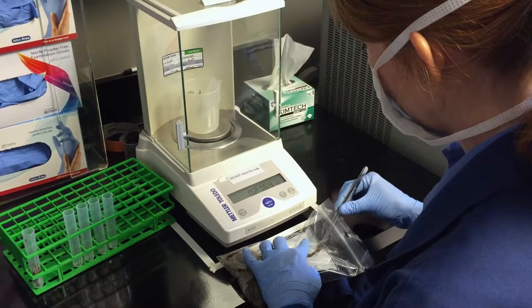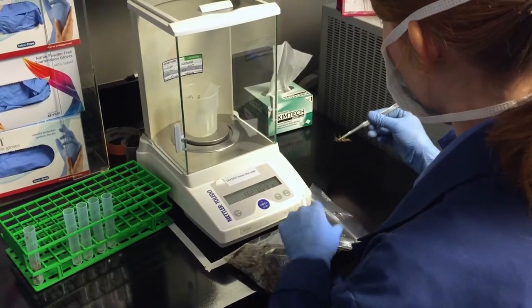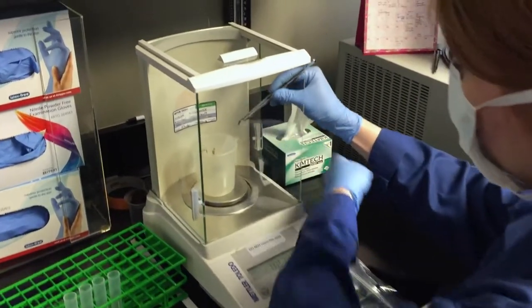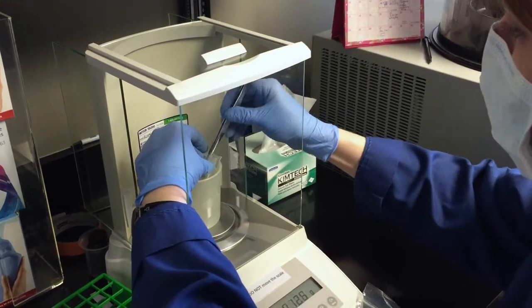So the first thing that we're going to do is we have weighed out a half a gram of feces into test tubes. We're going to add some buffer to it.